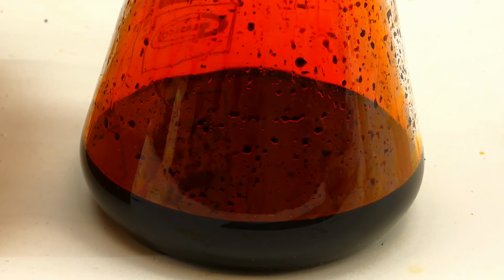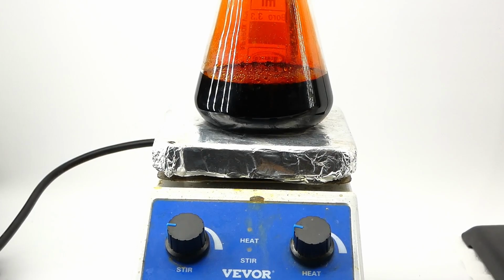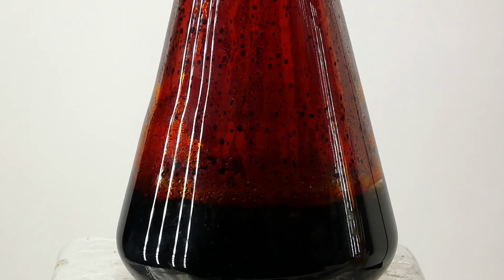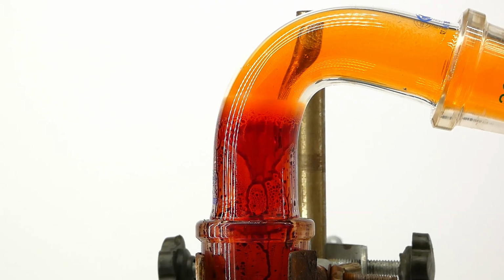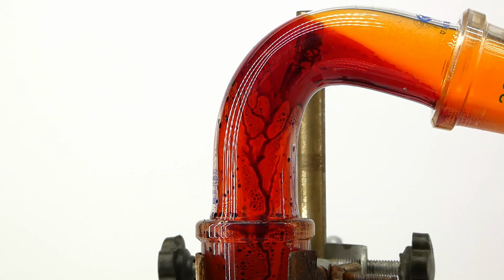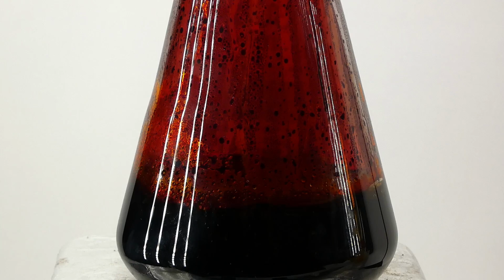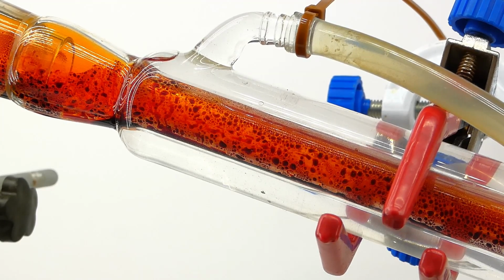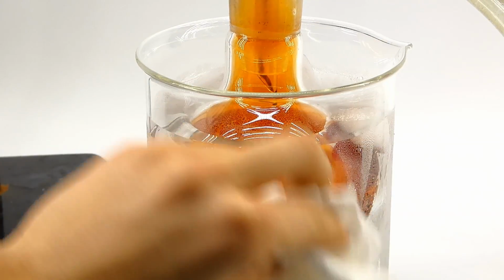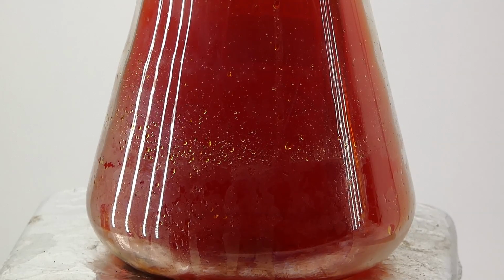However, I can't turn back now, so I assembled my distillation setup once again and started to gently heat the bromine. Fortunately, it didn't boil too vigorously, and the distillation went pretty smoothly, and if I don't think about all the potential disasters it might cause, it looks just incredibly beautiful. The boiling and condensing bromine is just very mesmerizing to watch, and it looks like some weird alien blood. The whole distillation is also quite fast, and in about 2 hours all the bromine came over to the receiving flask, leaving behind a few drops of sulfuric acid.